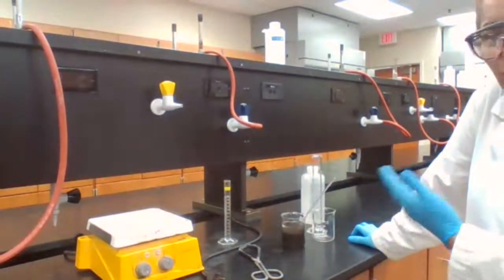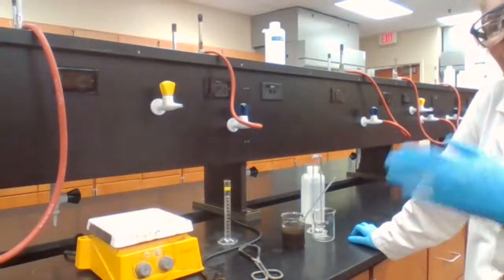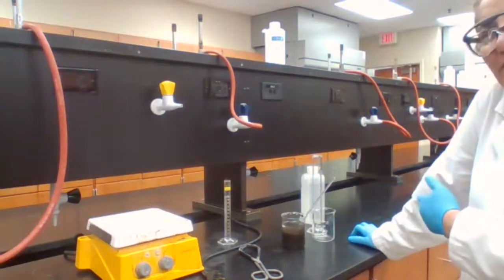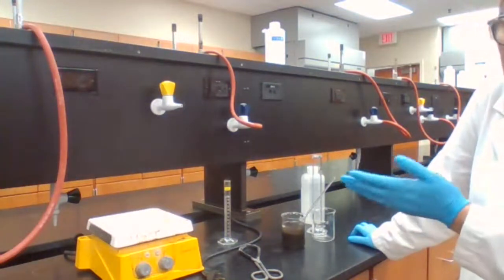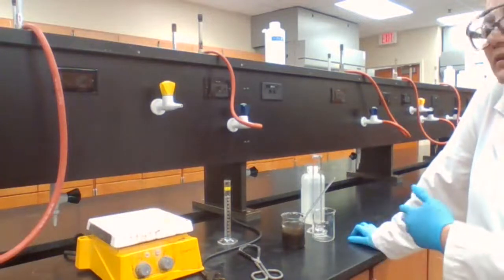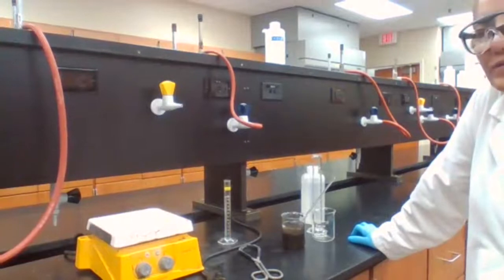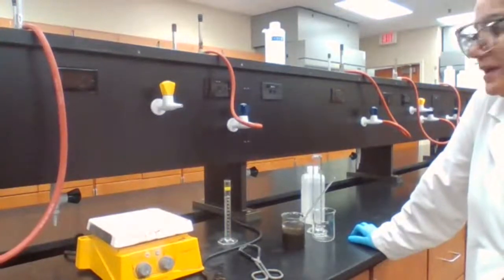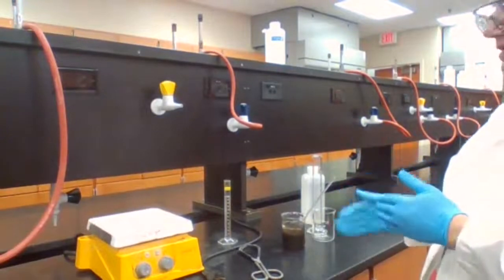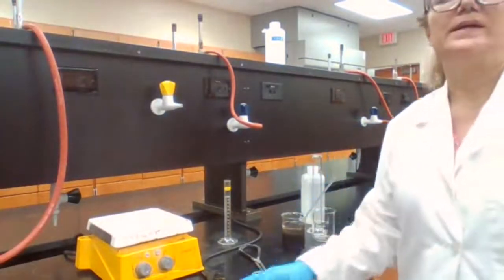And I don't like to rush for experiment anyway, but I like to use the time more efficiently because there's a step of this experiment that it takes longer, especially when you add the magnesium, it takes much longer compared to the other steps of the reaction. So I can save some time for that. And also, while you're waiting for one part of the experiment, you prepare your equipment and the chemical for the following steps.